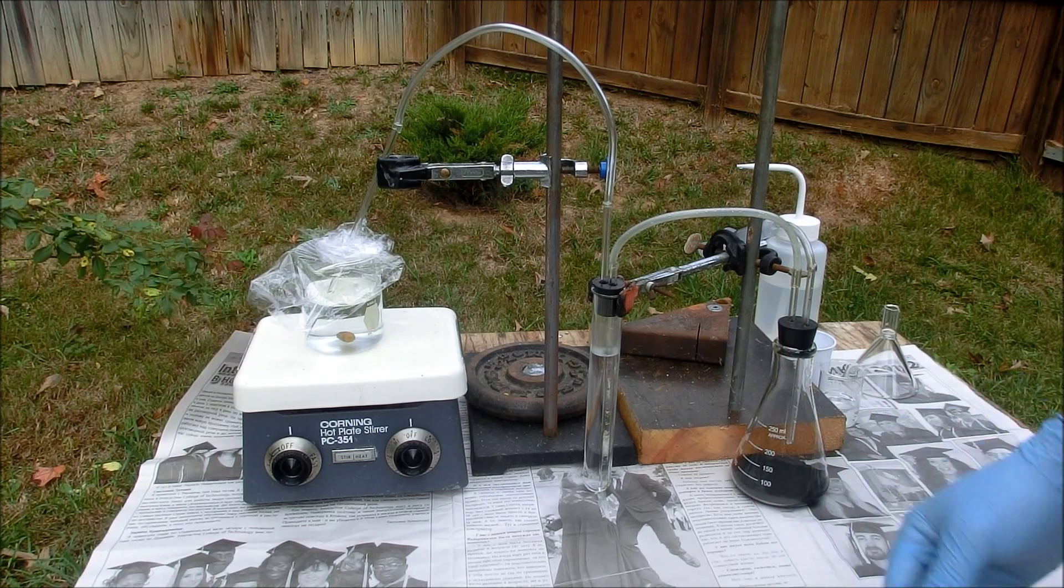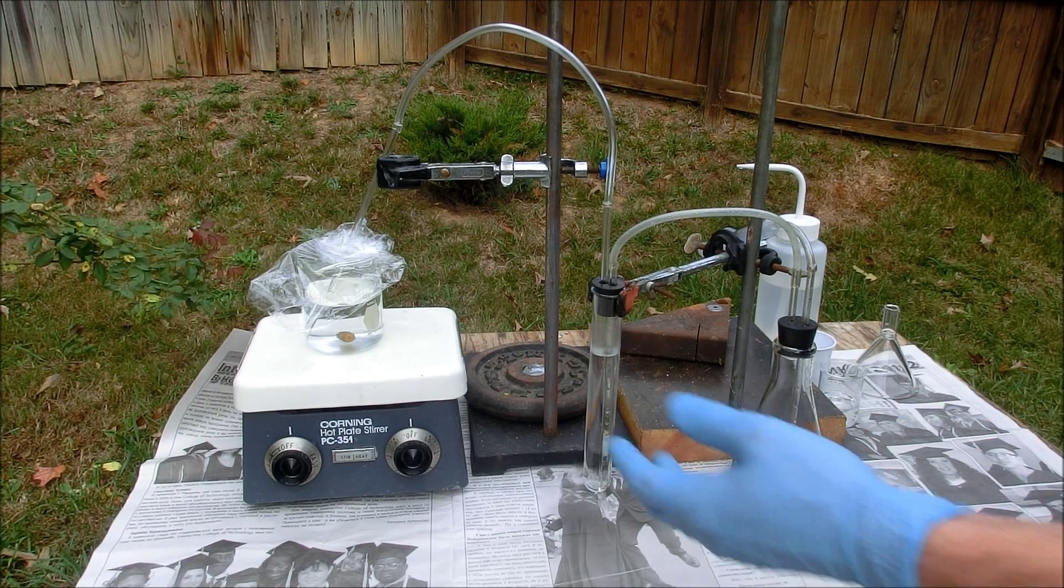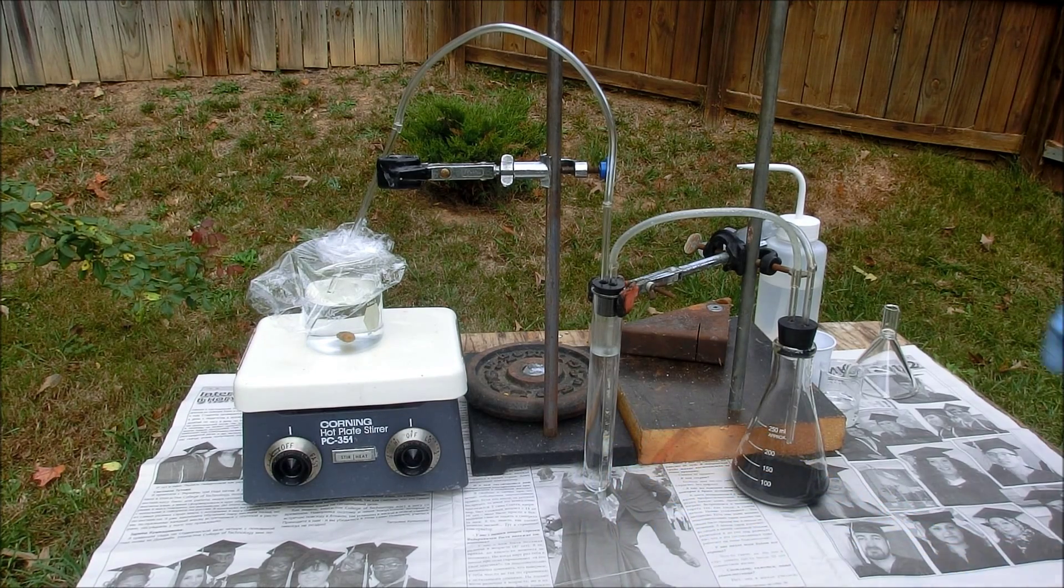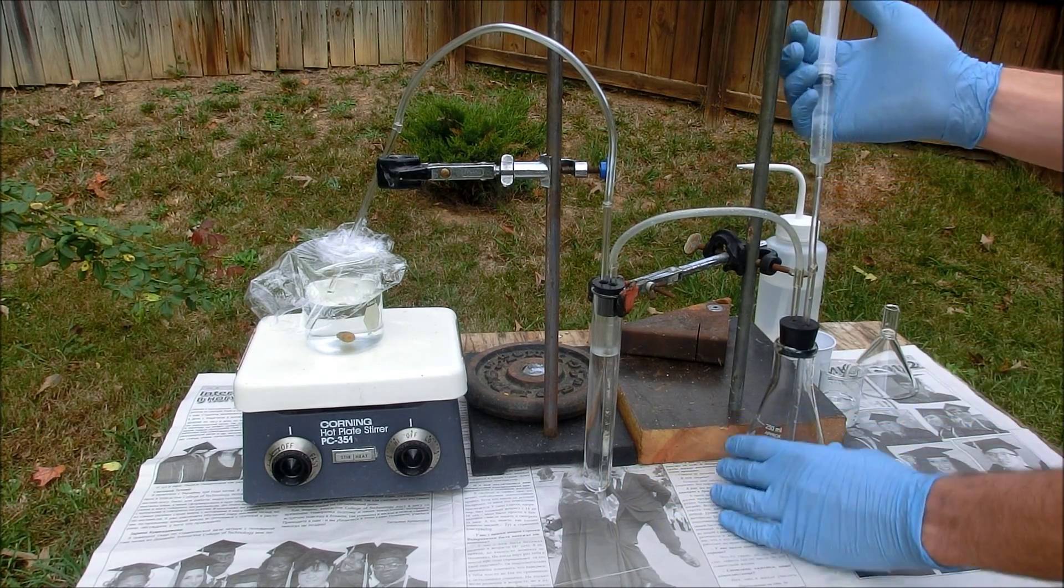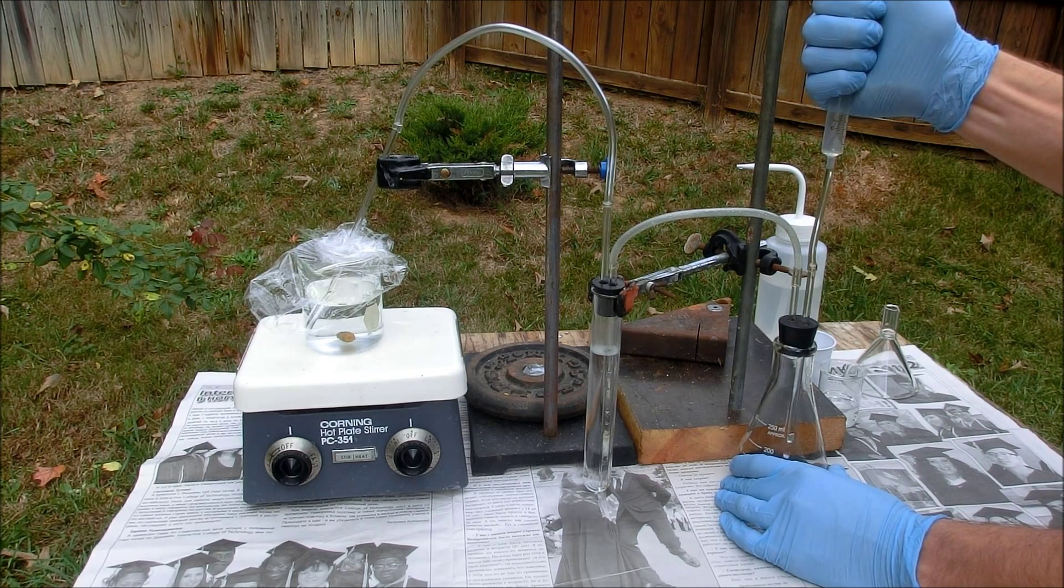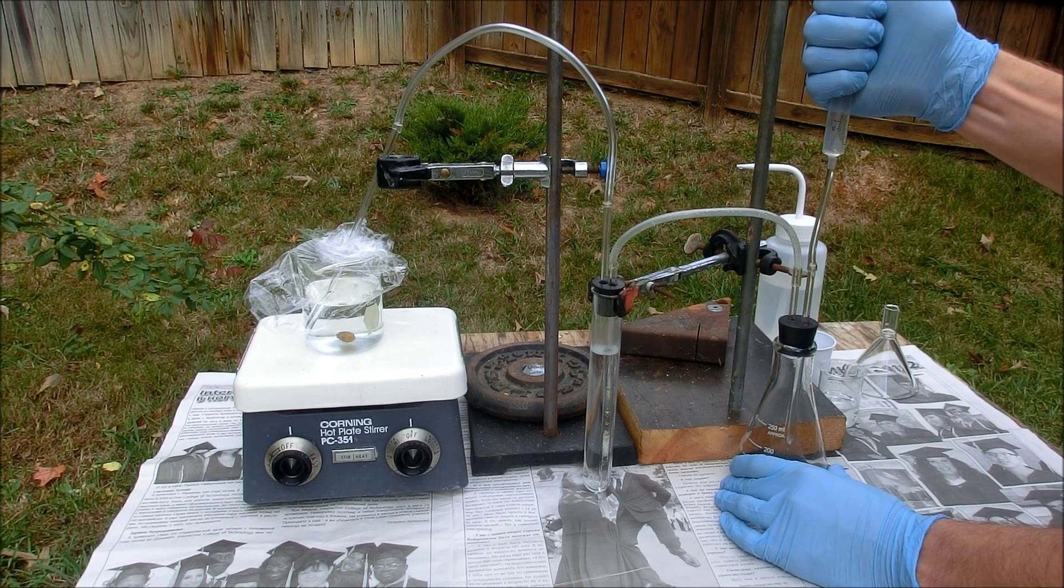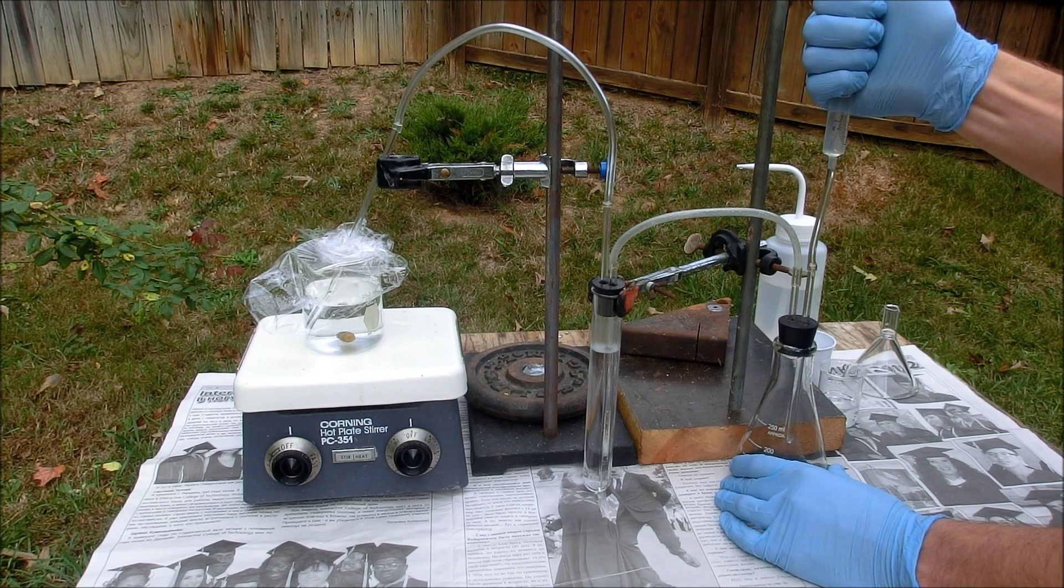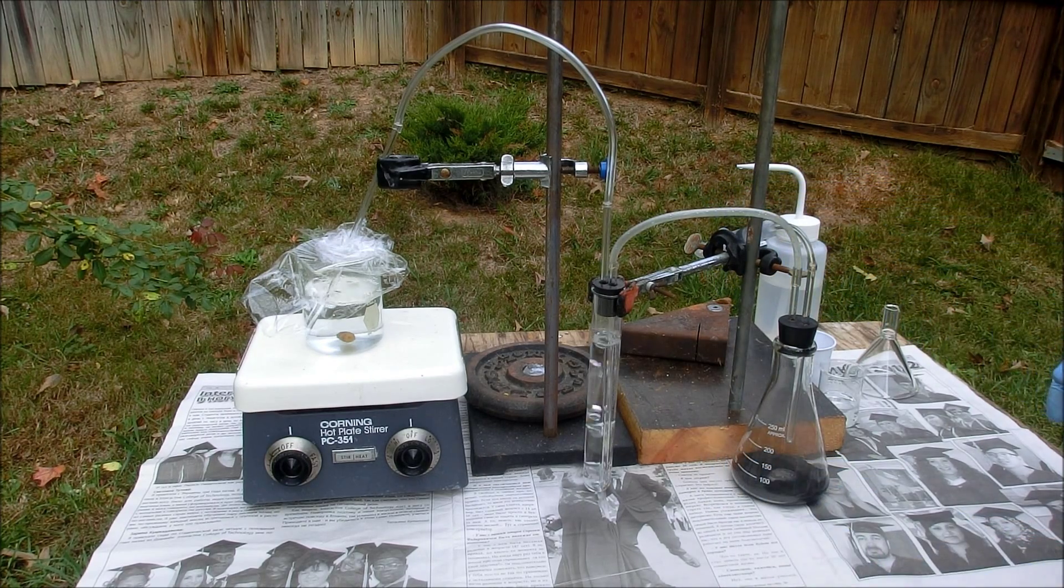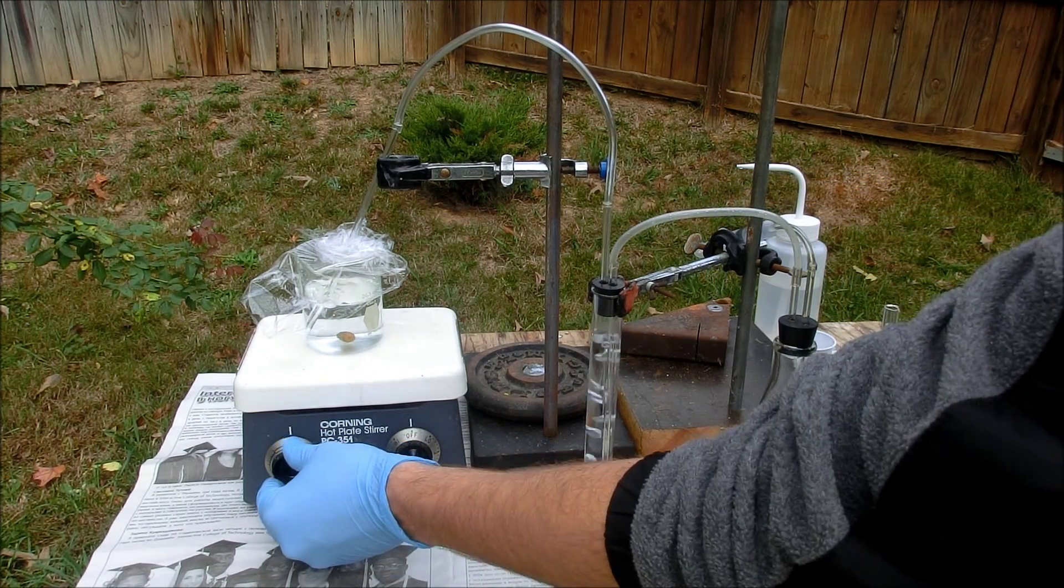And it should also help to keep the hydrogen sulfide gas in contact with the surface of the solution for a little bit longer. We'll turn the stirring on.